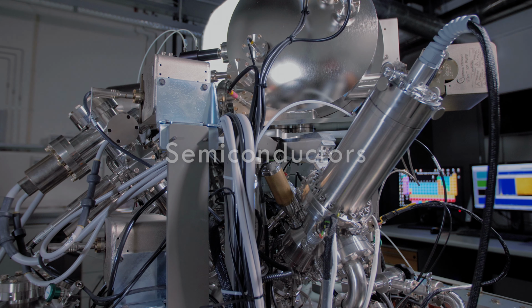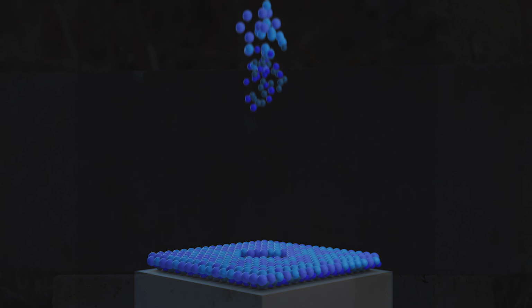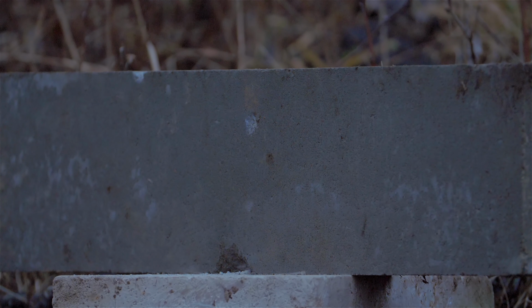The operator can choose between highest lateral resolution, called unbunched mode, and high mass resolution mode, called bunched mode, when doing analysis. In unbunched mode, the lateral resolution can be less than 70 nanometers. However, the mass resolution in this mode is about 600, which is considered only unit resolution. With unbunched mode, the mass spectrum consists of wide square-shaped peaks, giving mass unit separation of ions with no possibility to separate aluminium hydride from the silicon peak.